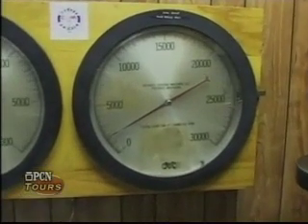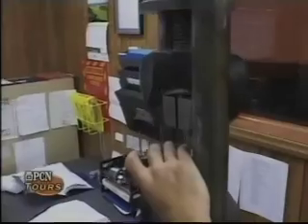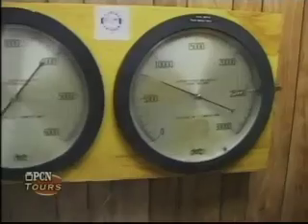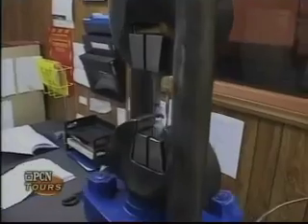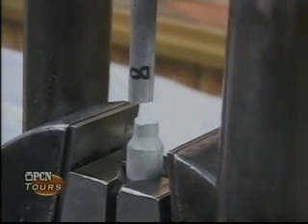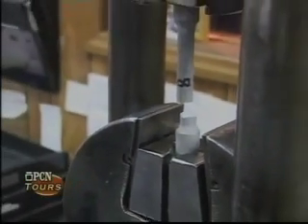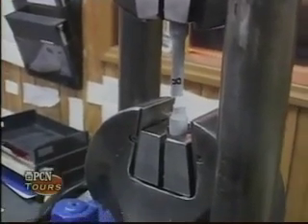What he's doing right now is holding the points in place, because that will actually stretch to a given dimension before it breaks. And it's going to break right about now. All right, so what we're able to do then is put that bar back together, and we'll be able to read how much it stretched before it broke. That's how we read our elongation, which is the ability for the metal to give as opposed to fracture, which is critical, especially in the electrical field that we make product for.